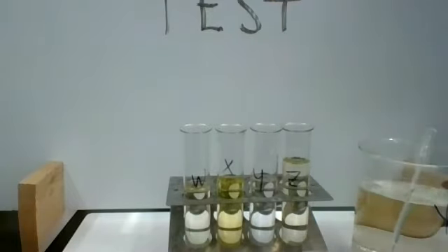Okay, so I'm going to get Benedict's out—Biuret's. Thank you. Miss Fistrick's here helping out. Good stuff. This is Biuret's. My bad. Okay, here it goes.